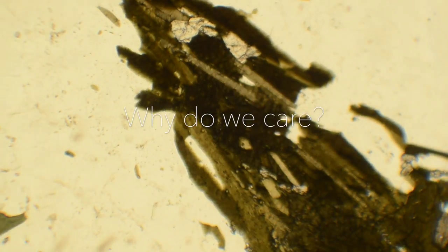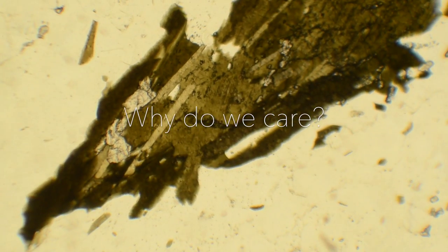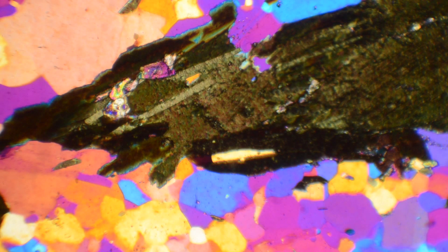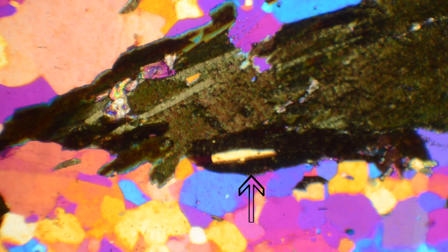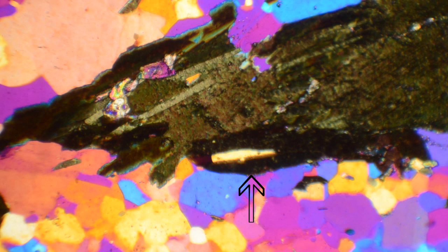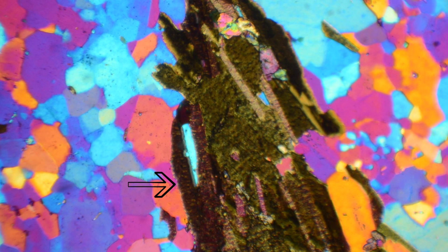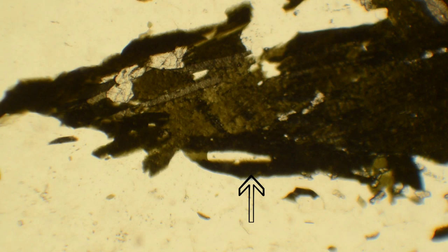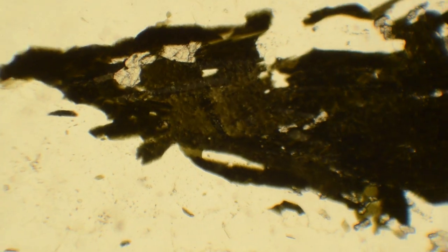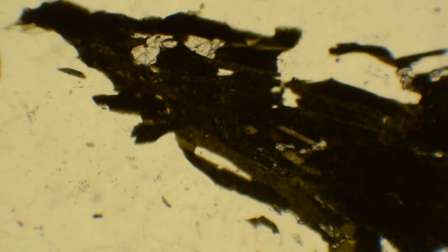So why do we care? Some types of mineral grains display different color or relief along their fast or slow rays. In this snapshot of this pleochroic mineral where the accessory plate is inserted, take note of the interference color where the arrow is pointing. Also take note of the interference color 90 degrees away. As I switch back to plain polarized light, notice the color of the mineral in this orientation versus this orientation. For pleochroic minerals like the one being shown here, we can describe relief and color in plain polarized light along a fast or a slow ray.